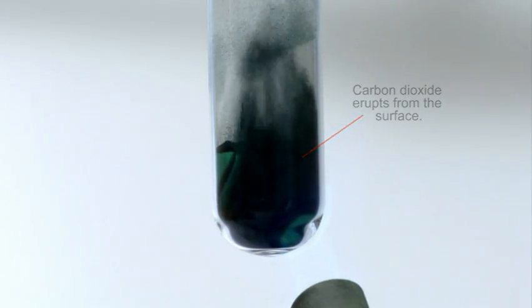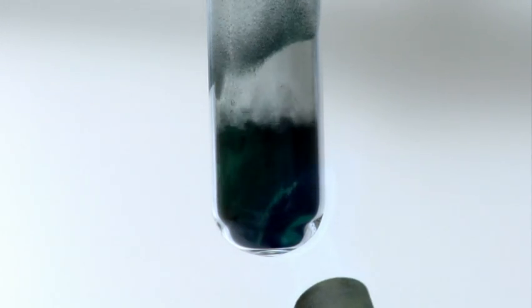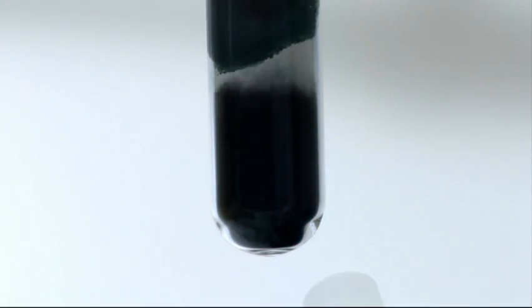This rapid gas evolution gives rise to the common misconception that a boiling black liquid is formed. This is not the case. In this reaction, no liquid is formed, and the appearance of boiling arises from the fine particles of black copper(II) oxide.